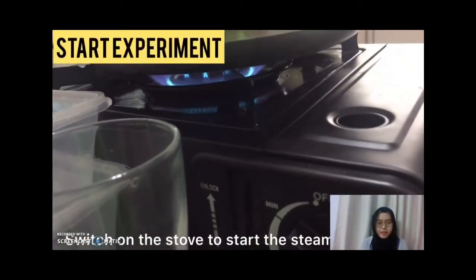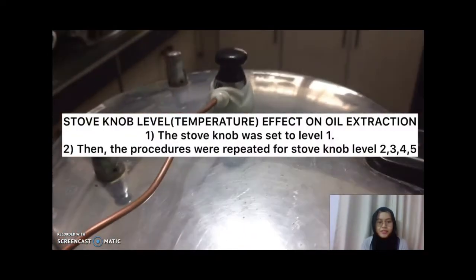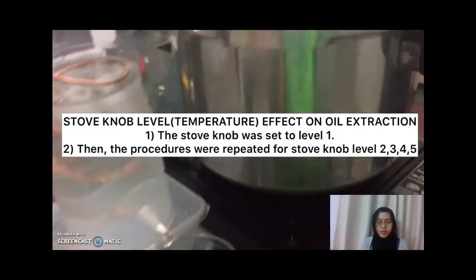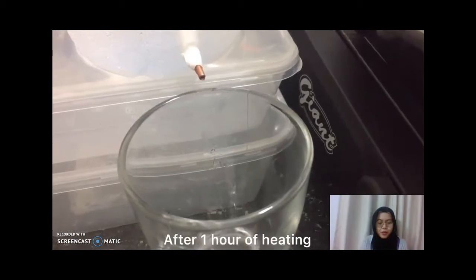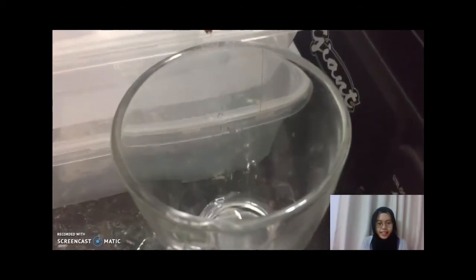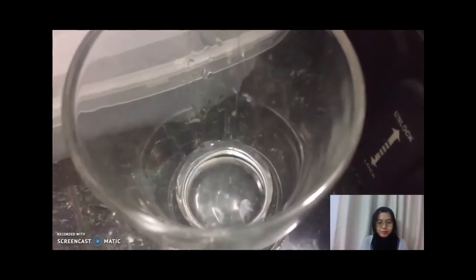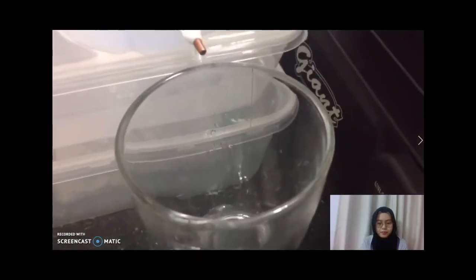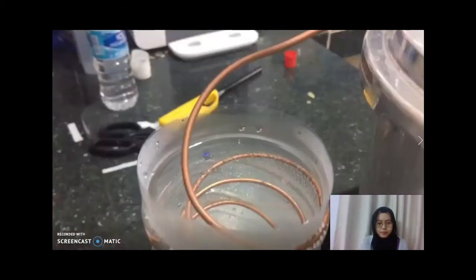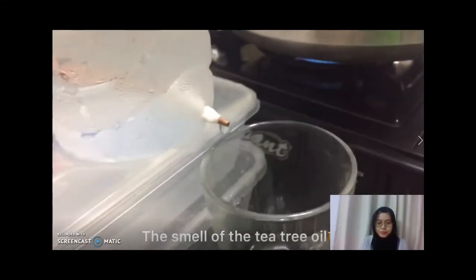And we're going to start the experiment with our first factor. The first factor is the stove knob level, the temperature effect on oil extraction. After 1 hour of heating, we finally managed to extract our tea tree leaf oil. And the smell is also quite good.